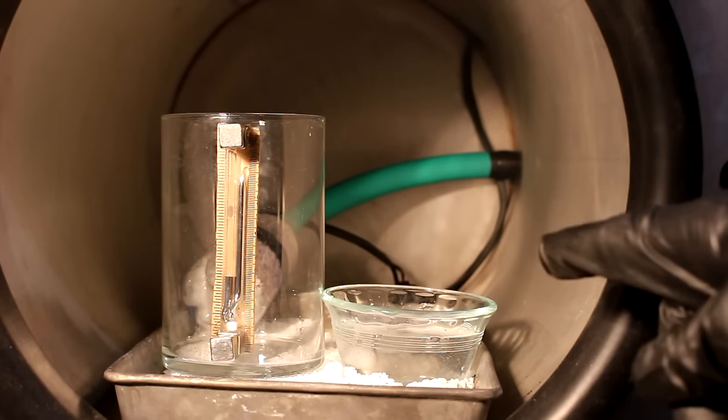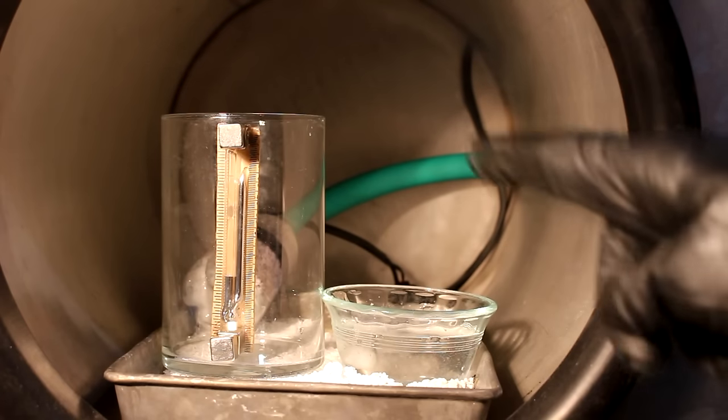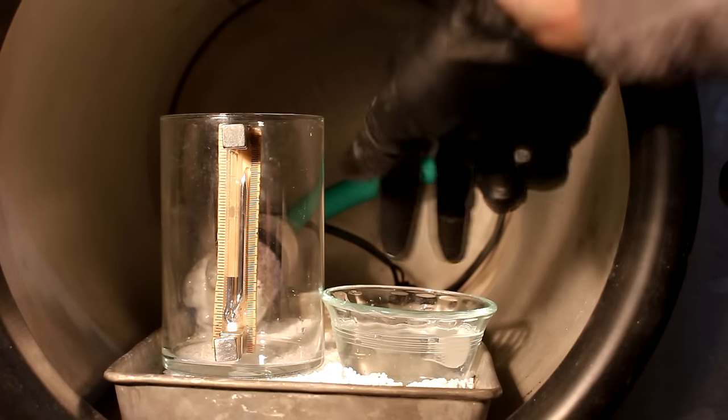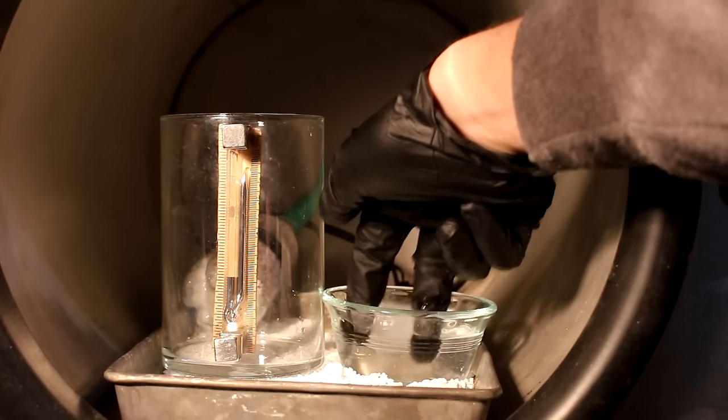But now I want to know what happens if I do this same experiment inside of a vacuum chamber. You can see that the water has an ice cube in it to keep it from boiling.